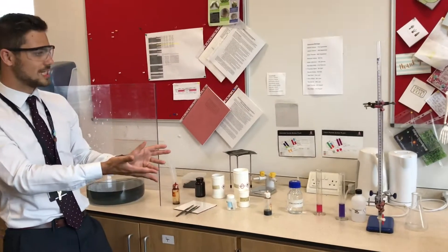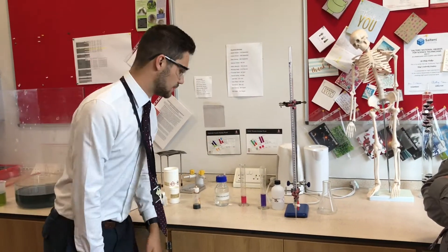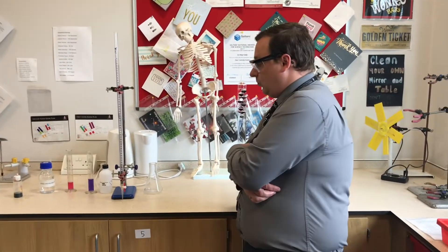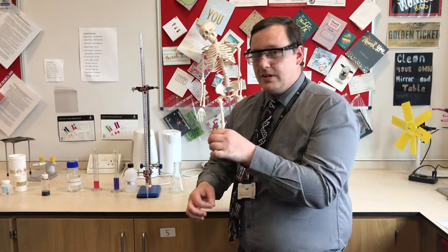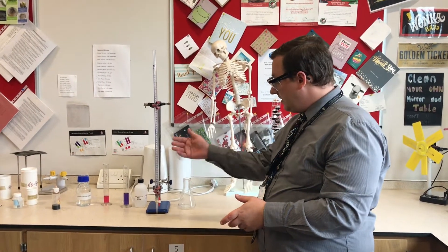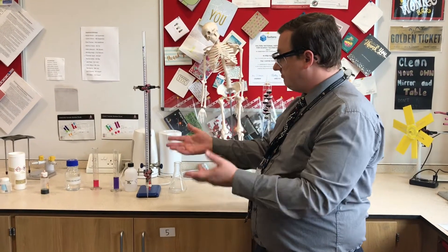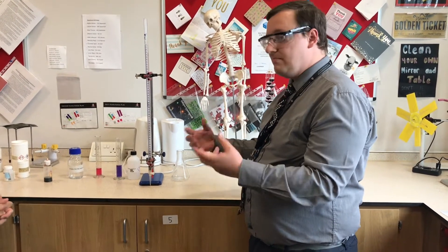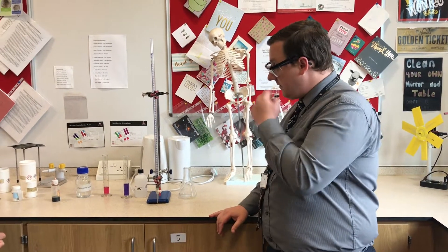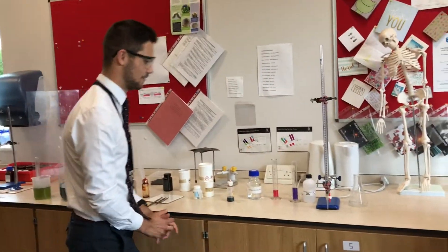So what we're going to do today is put these two solutions in the burette and see what happens. Any ideas before we start, Mr. Walker? Well, I know that when you react an acid with an alkali it's a neutralization reaction, so it's going to become green because the pH will be 7 — universal indicator would make it green. I've seen that done many times, but I know this will be a little bit different because we've got the burette, so I'd expect some kind of neutralization to happen.